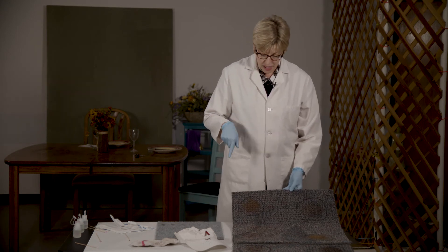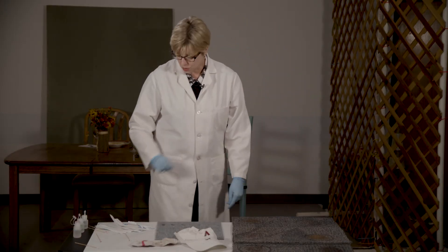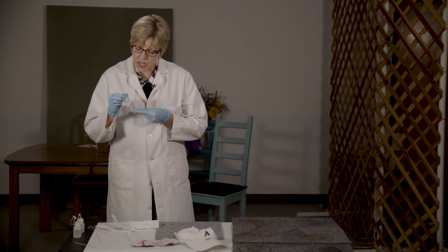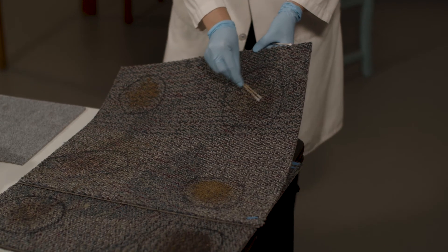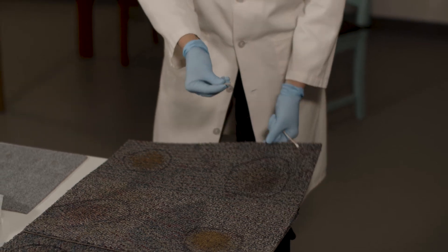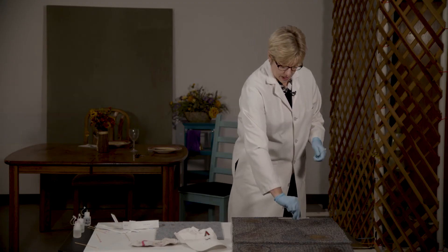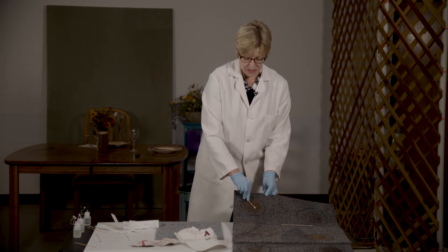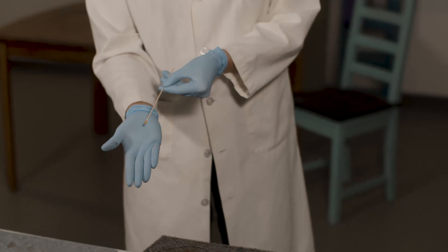These carpet squares have examples of stains and substances that can look like blood. Audience at home — guess which one might test positive for blood. I'm wetting swabs with deionized water and testing two stains. This is Stain A — I'll rub it hard to get a good color transfer. And this is Stain B, which looks a little orangey and crusty, probably not blood.